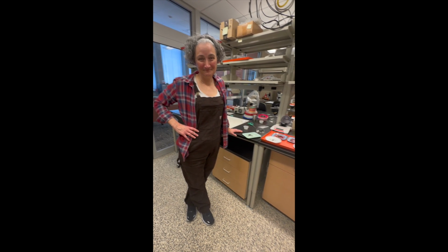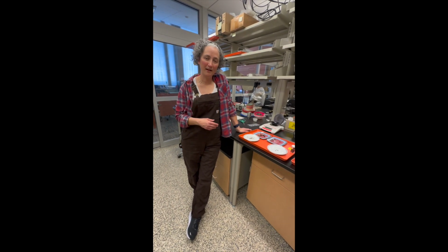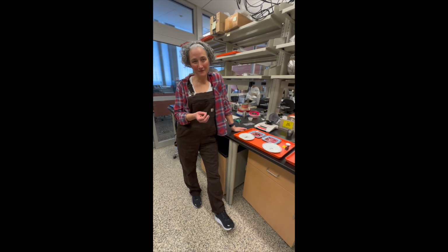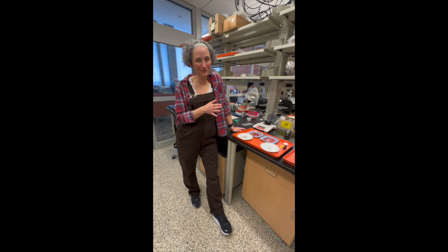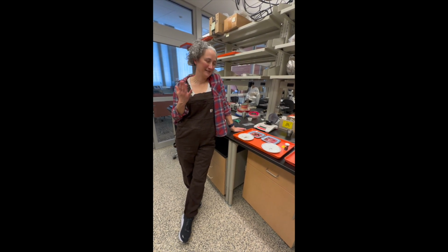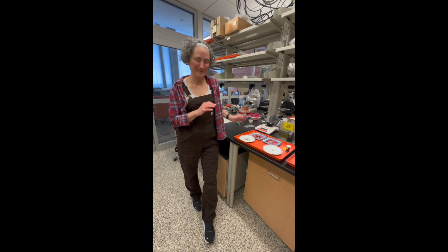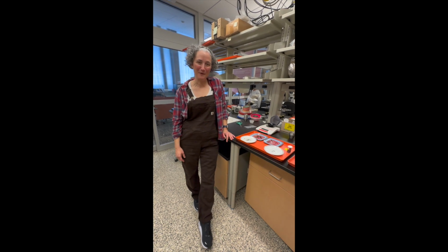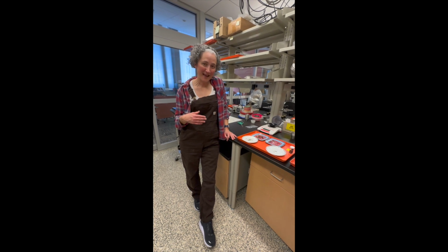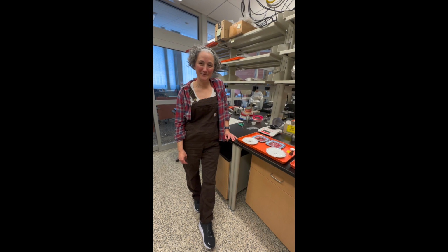So there's always opportunities to come in and help, especially with rough sorting, especially those heavy fractions. Again, they're a lot of fun because you get to see a lot of little tiny things, and they look really cool underneath the microscope. And you just kind of get to sit and you can listen to a book on tape or anything like that, and look through and make little piles underneath the microscope. It's really kind of satisfying and a lot of fun. So if you're interested in doing that, feel free to reach out to me. I'm more than happy to set you to sorting.